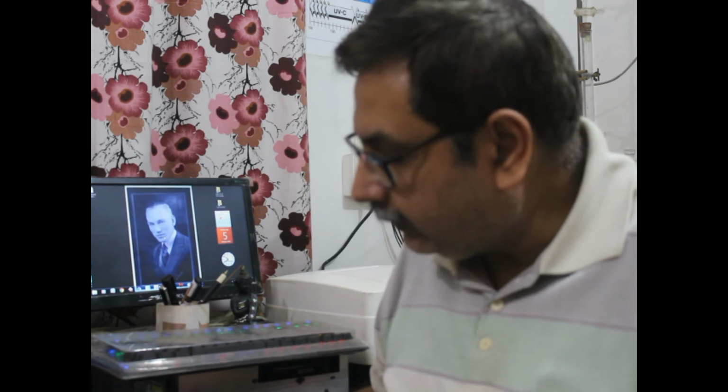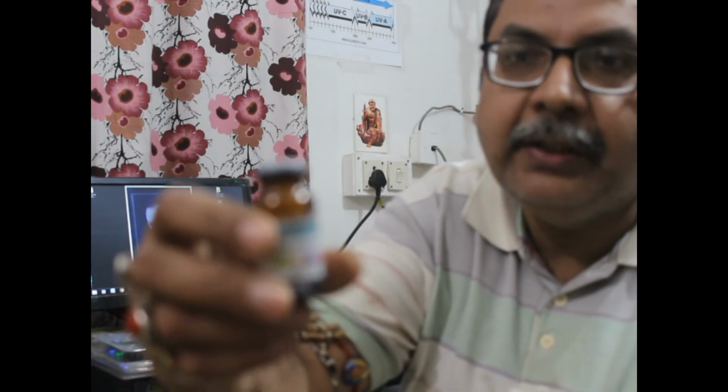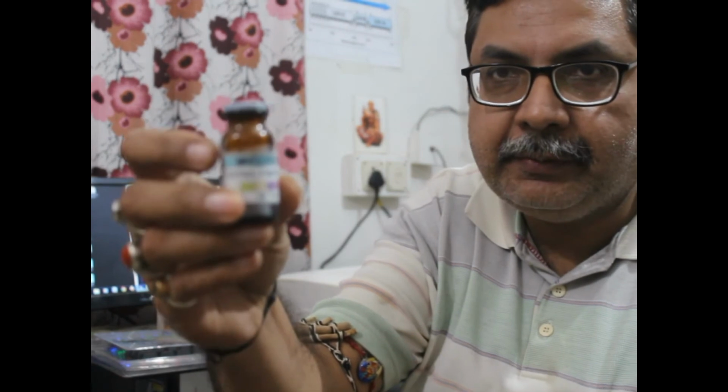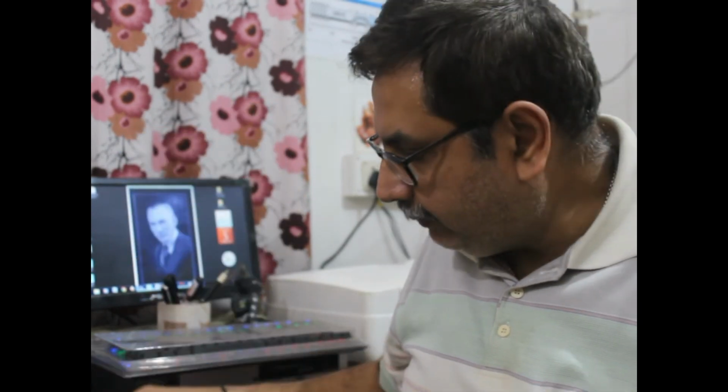These Tremorgens are, as you can see, this is the mycotoxin. It's bottled in this bottle, and it has been labeled. 5 mycotoxins you can label. The camera is not very good. My camera is not very good. Anyway, we can see the mycotoxins. So this has been bottled. Especially it has been extracted and kept in a bottle.